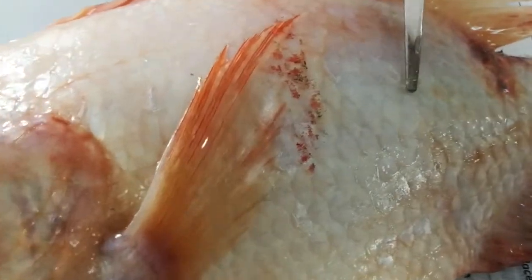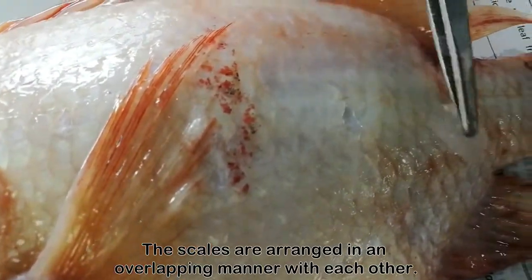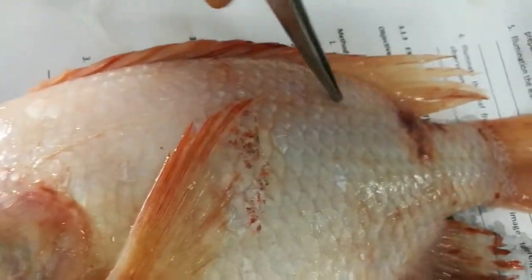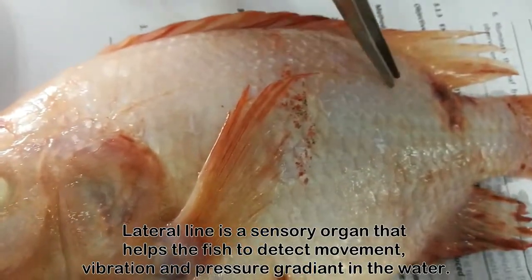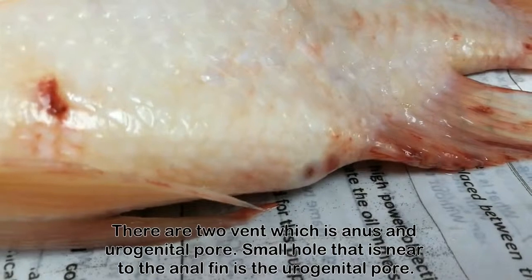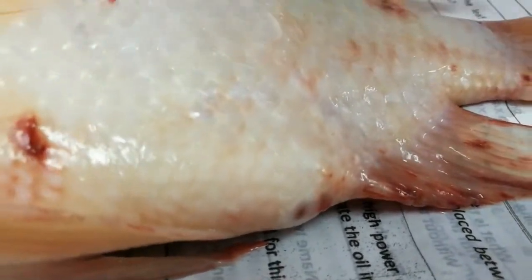You can also see the scale — this is the scale of the fish. The lateral line is visible here; it is actually a sensory organ. The vent is the small hole over here. This is actually the external opening of the digestive, urinary, and also reproductive tract.